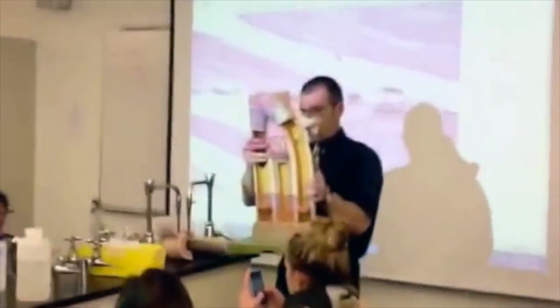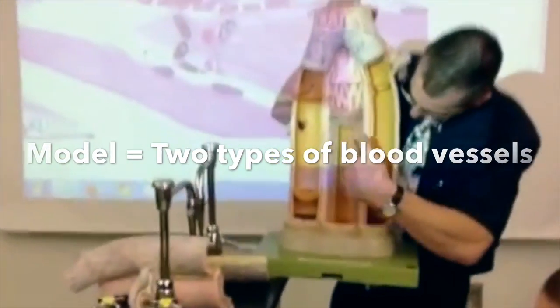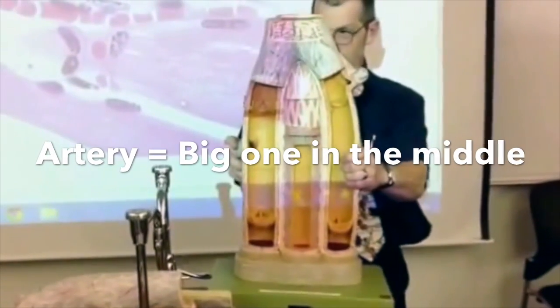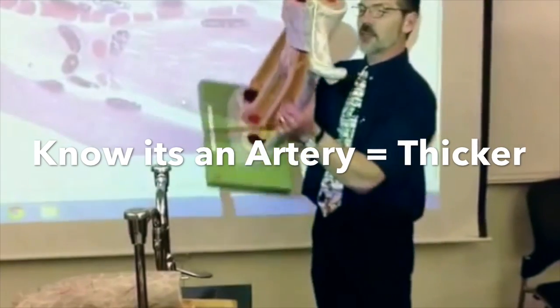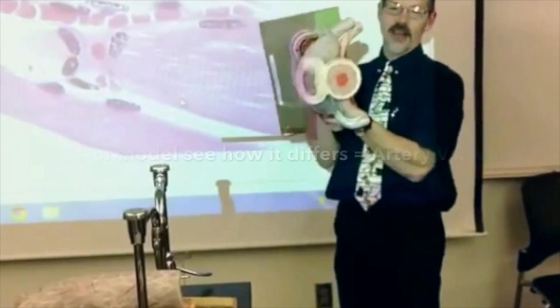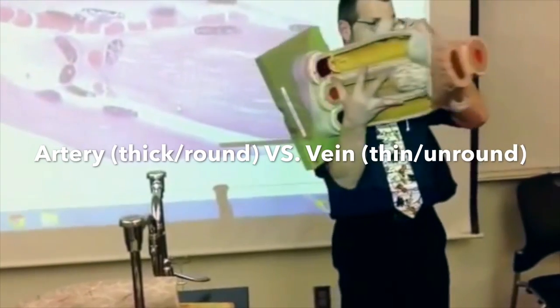All right. This represents two different kinds of blood vessels. We have the big guy in the middle, and we have these two. The big one in the middle is a what? Artery. How did you know? Thick walls. And if you turn it this way, you can tell right there: round and not round, thick and thin. That's the trick you want.